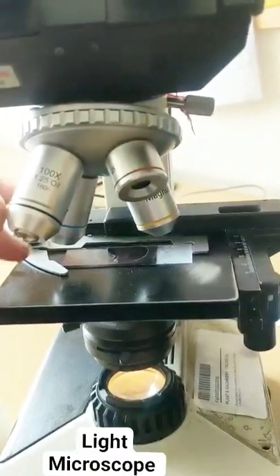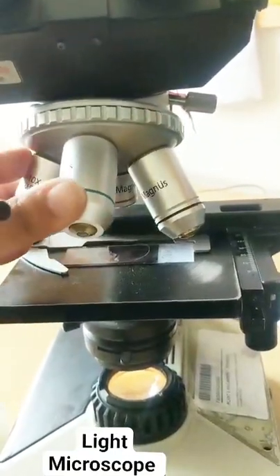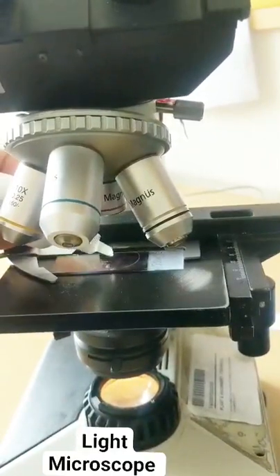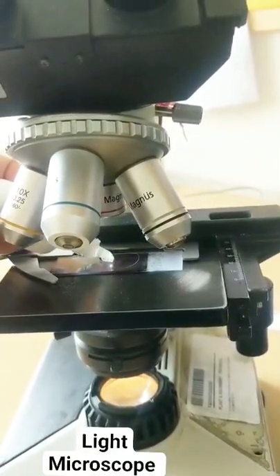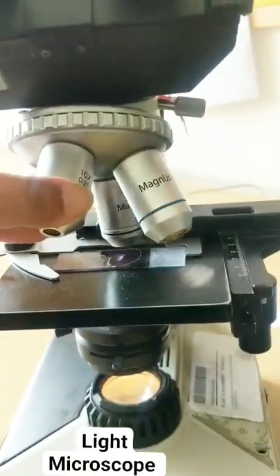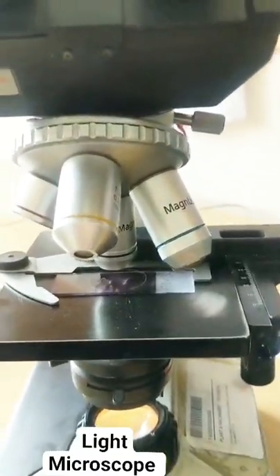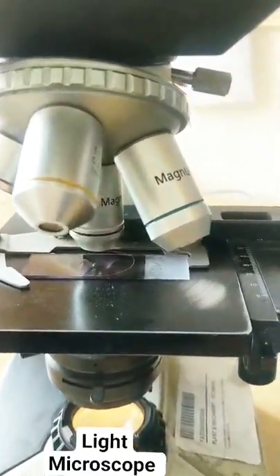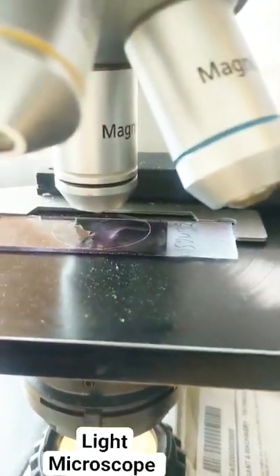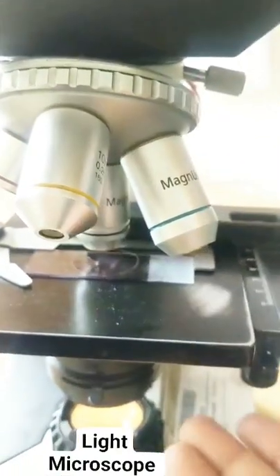What am I going to do for viewing something in oil? First, I will just put a tiny drop of oil over here. Having put that, I will place this particular lens. But now I see that the lens is not in contact with the oil — the slide is not in contact with the oil. So I need to move the stage.